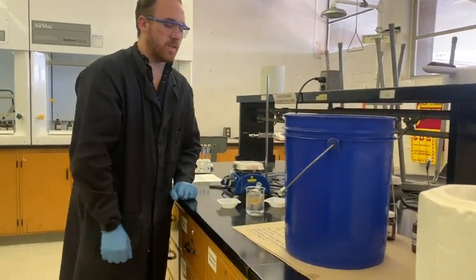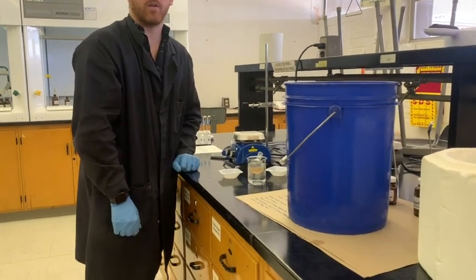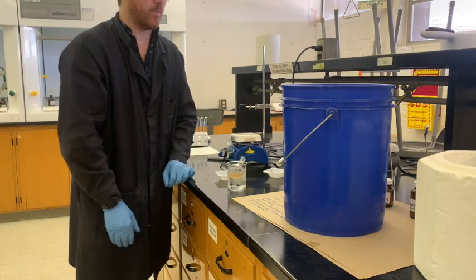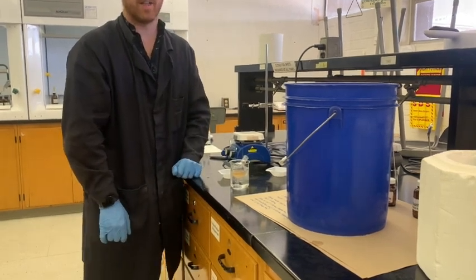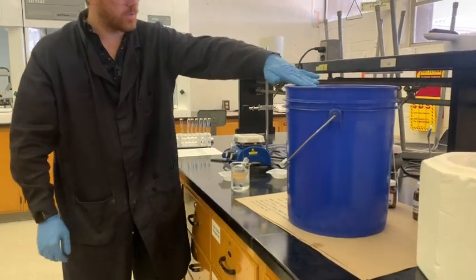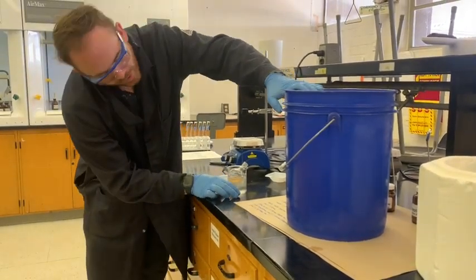Make sure that when you leave it to cool down, you know that it's not going to also submerge itself in your ice bath and contaminate the contents of the flask. That's worth noting. Kind of one of those little practical tricks there.